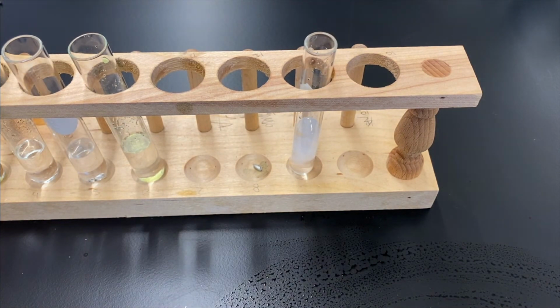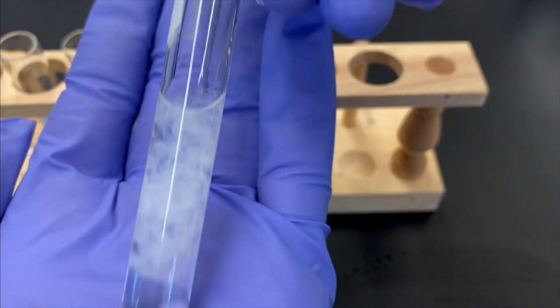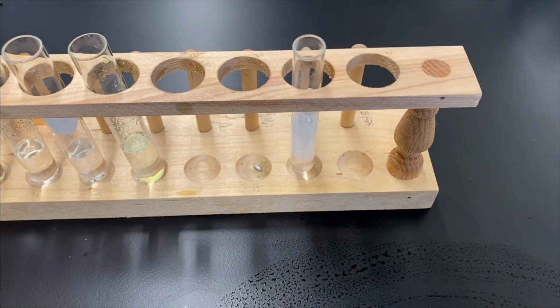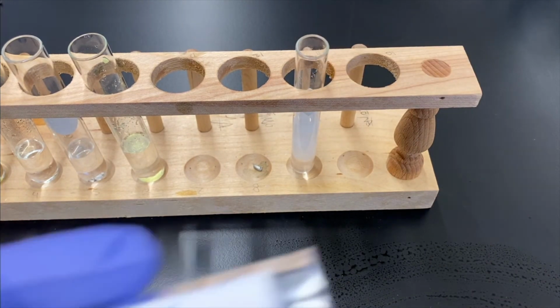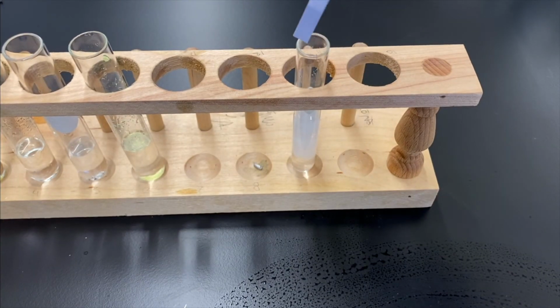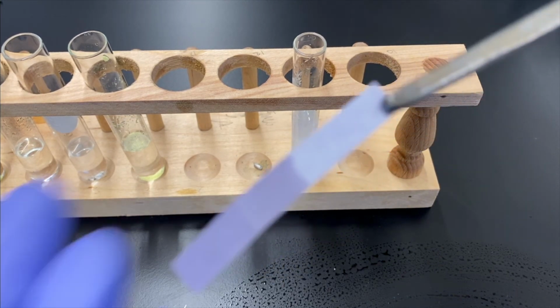See, we kind of get a precipitate there. I'm going to add some more sodium hydroxide. All right, now we're going to take our blue litmus paper again and let's test it. If it's still red, then it's still acidic. But if our blue litmus paper stays blue, then it means that the sodium hydroxide that we added made it basic. And there you go, blue staying blue. So that sodium hydroxide we added made it basic.